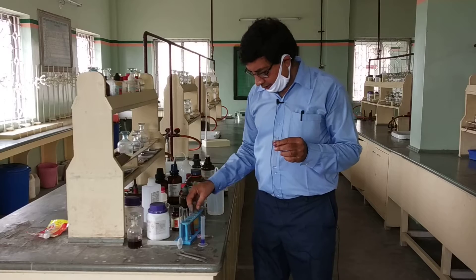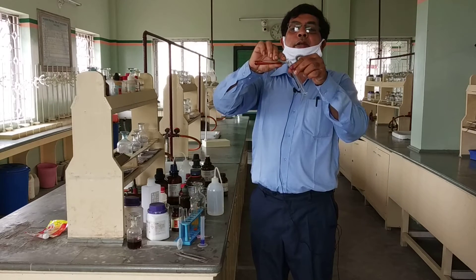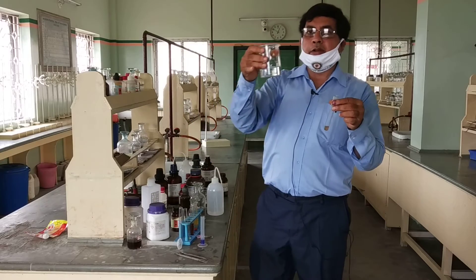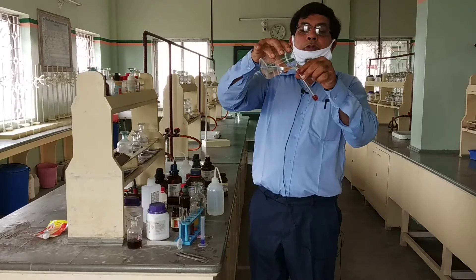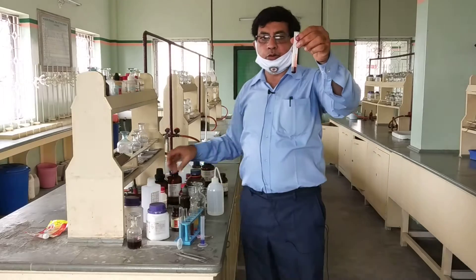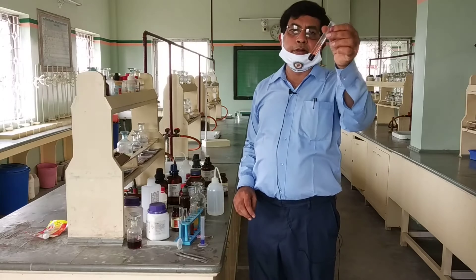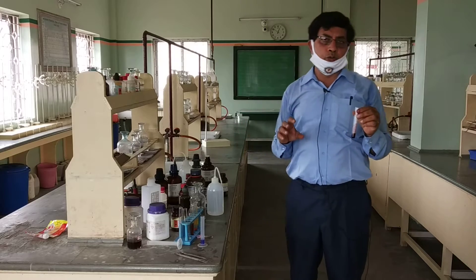Now you add sodium nitroprusside to the acetone, then you add sodium hydroxide solution. What do you obtain? A deep red color. So you take the sample, add sodium nitroprusside, then add sodium hydroxide — a deep red color is obtained. These are the two important tests for the keto group.